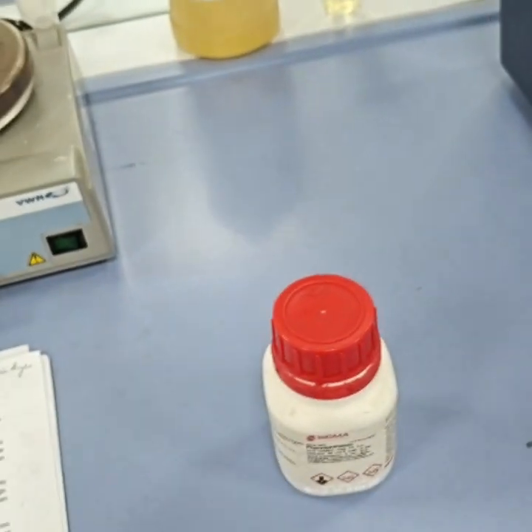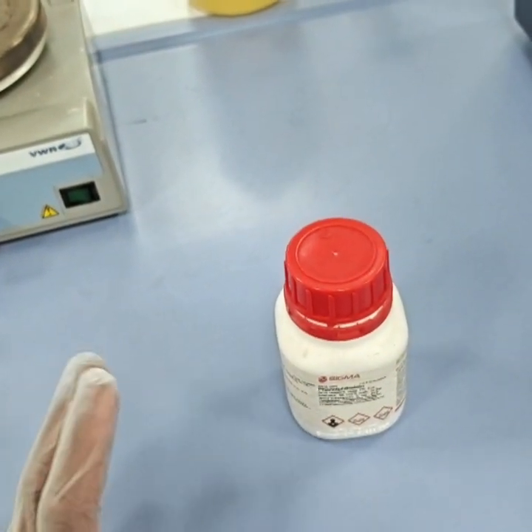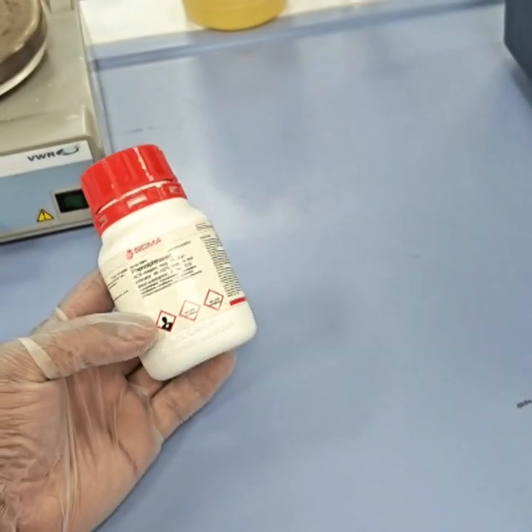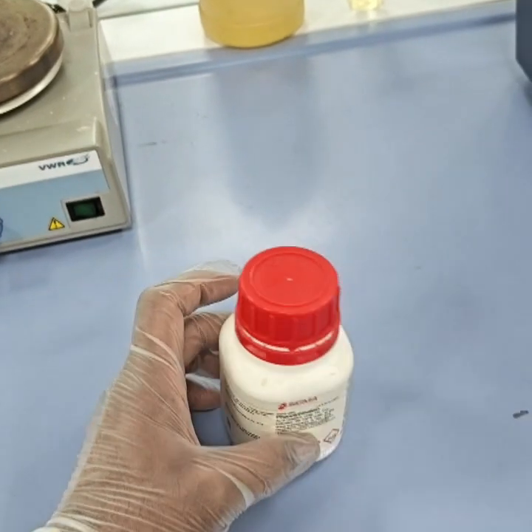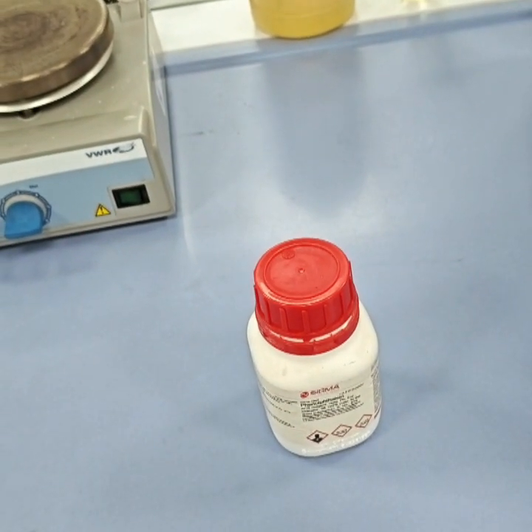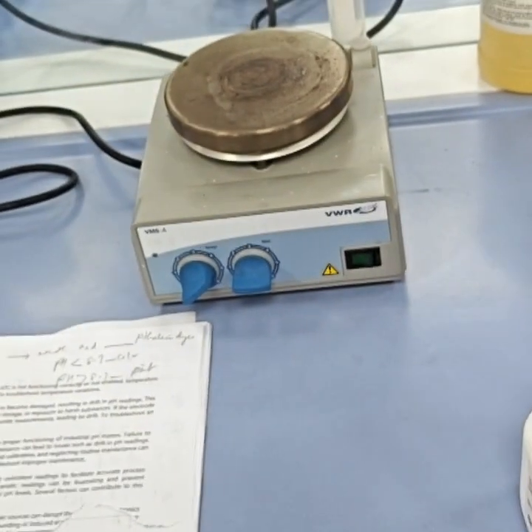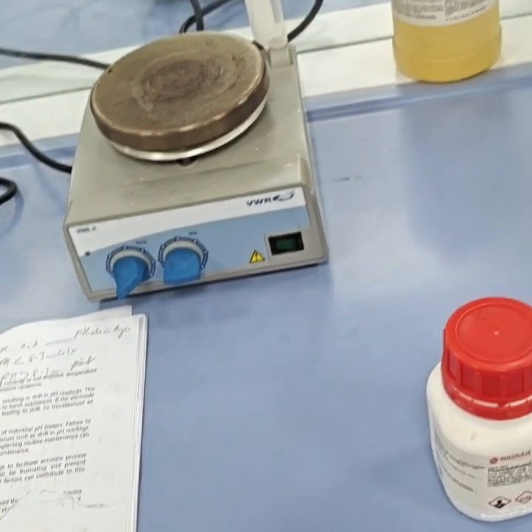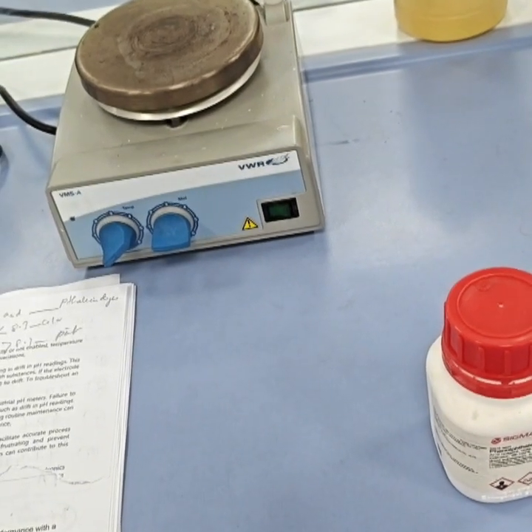And this has a unique property: it is a weak acid belonging to the phthalein dyes, and this phenolphthalein indicator is basically colorless when the pH is less than 8.3. When the pH is more than 8.3, it becomes pink. And the pink color is reversible. When you add an acid to that, it will become colorless. When you add a base, it will become pink. So this is a reversible kind of reaction that goes on with phenolphthalein.